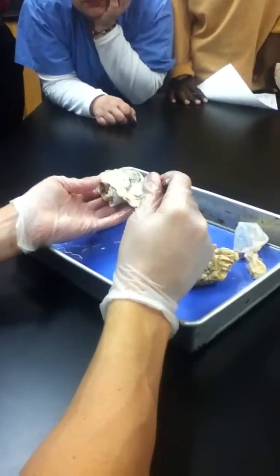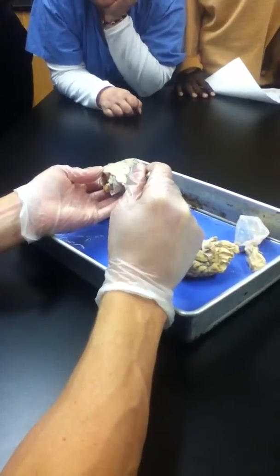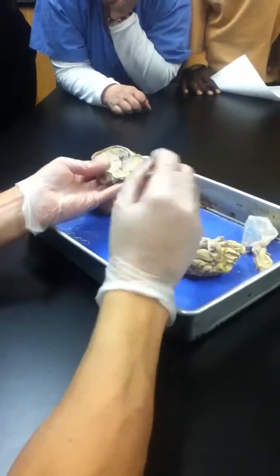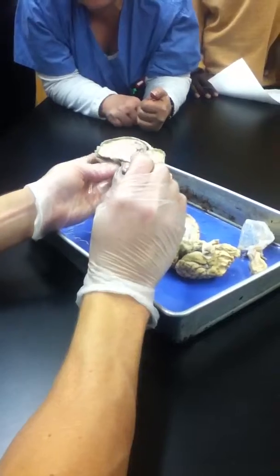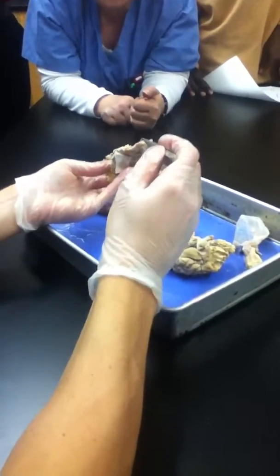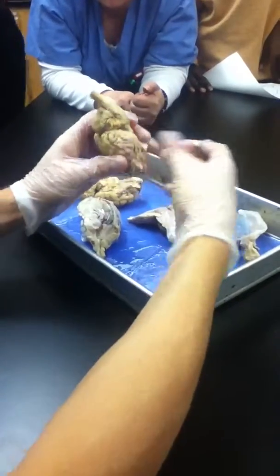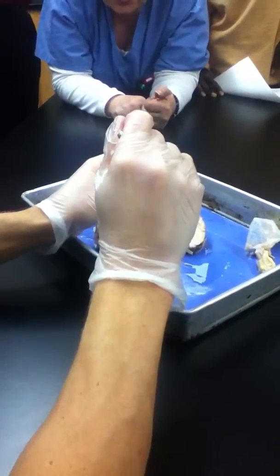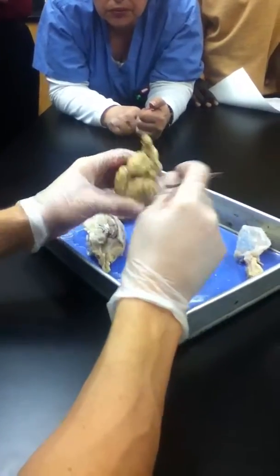There's another space way down here in between the cerebellum and the spine and the brainstem, fourth ventricle. And then look at this. The central canal of the... Yes, you even see some central canal of the spinal cord, the hole that goes right in the middle. And I bet, sure enough, if we were to look at one as a whole, you can find that, yes, there is a space going right down the middle of it, central canal of the spinal cord. Good.